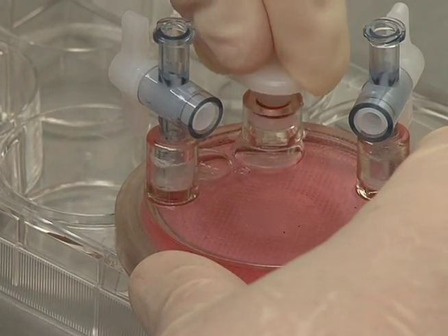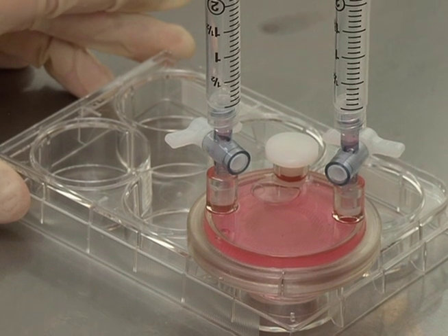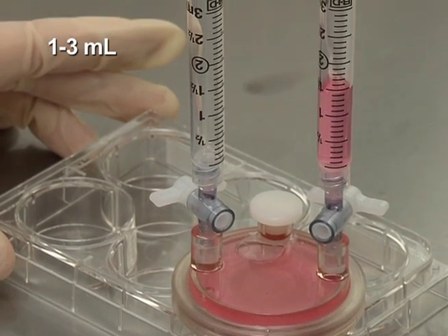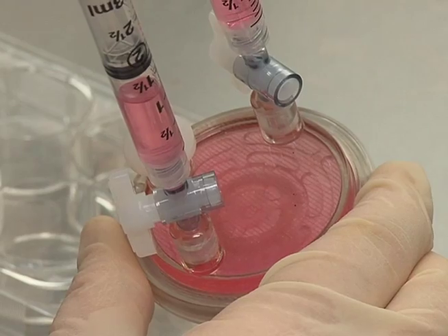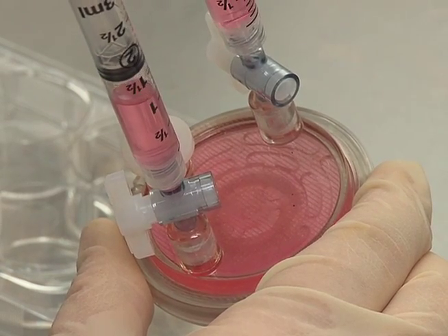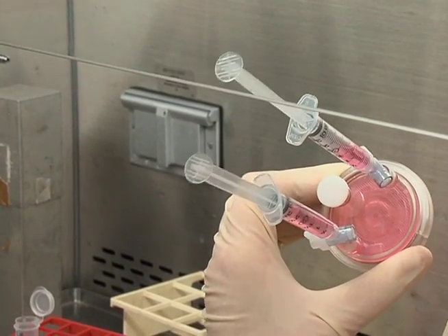Replace the large port stopper and close the small ports. Next, position empty 3-milliliter syringes onto the two small ports. Add media to each syringe, slowly open the two valves, and replace the syringe pistons gently. Add media from one syringe until all air bubbles are expelled from the inside chamber. Pick up the RCCS and gently tap the side while rotating it to check for bubbles.